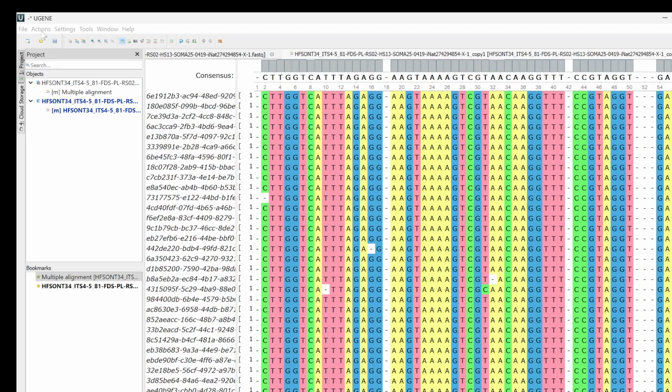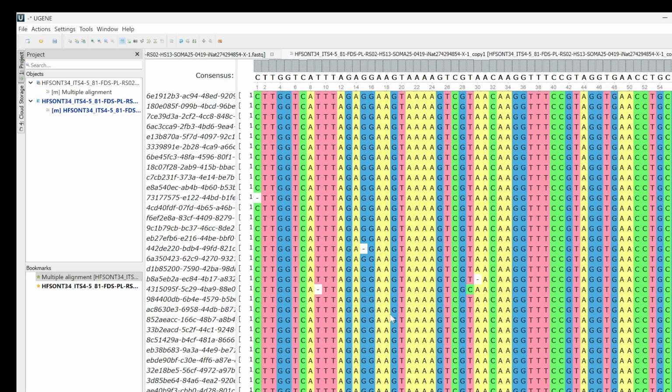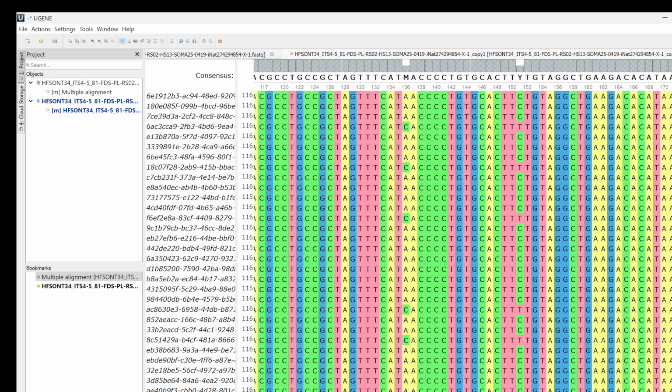And while this is grayed out, it's doing whatever it's doing in the background. It's quite annoyingly long sometimes, but take a moment to meditate. All right. Hopefully you've achieved some sort of spiritual harmony here. So let's look at the sequence.